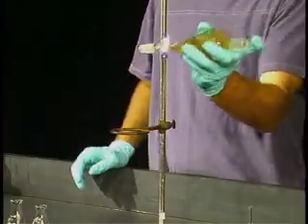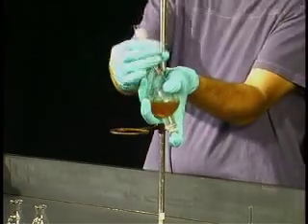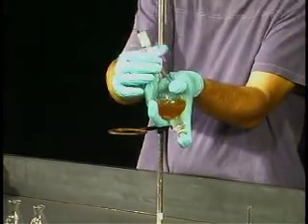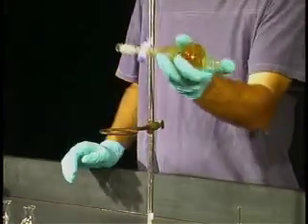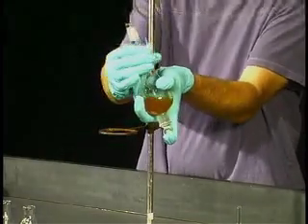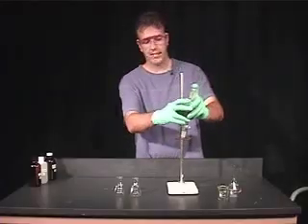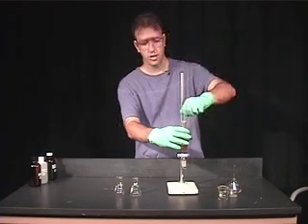Or you can really shake it a couple of times and release the pressure — you want to do that three or four times. What this is doing is basically allowing the two solutions to come into contact with one another. The more surface area, the more contact, and the better transfer of caffeine to the organic layer.